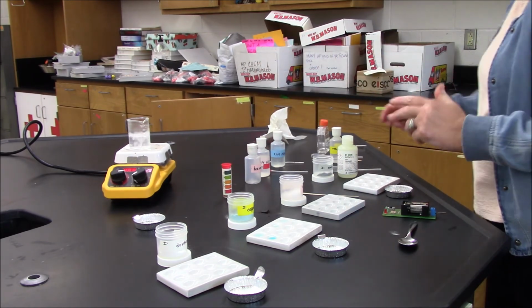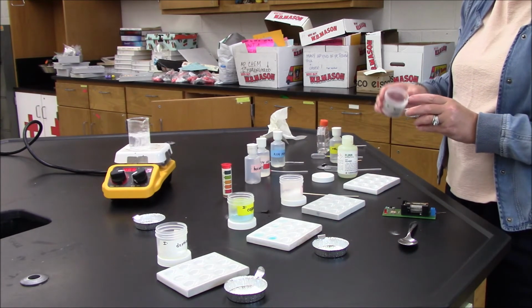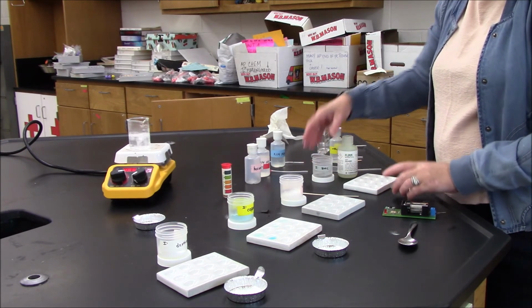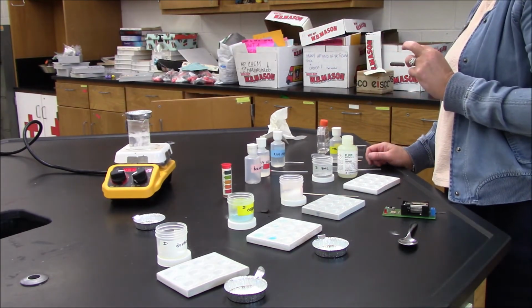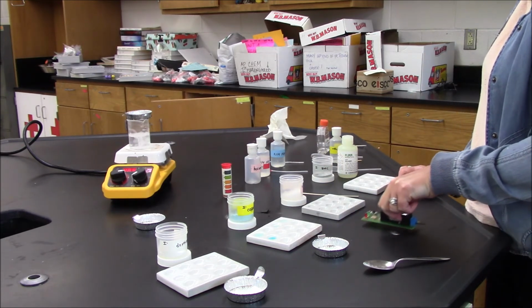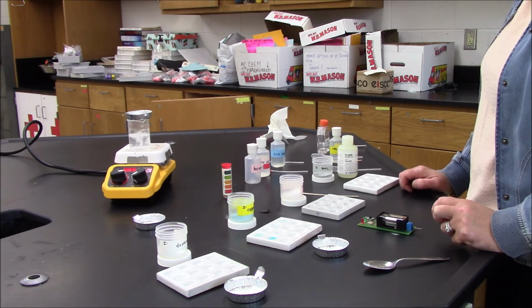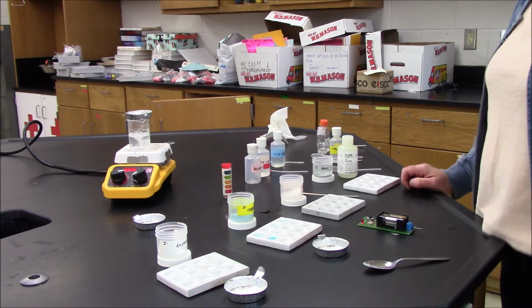Lastly, I'll check its melting point, but I think we all know that nothing is going to happen here. In fact, I think I'm just going to add a single pellet. We'll let it sit. I could let this sit forever and there will be no observable change. This definitely melts at a temperature greater than 100 degrees Celsius.